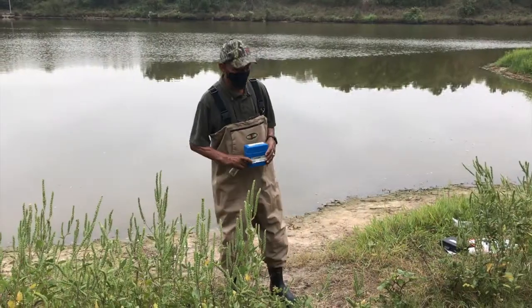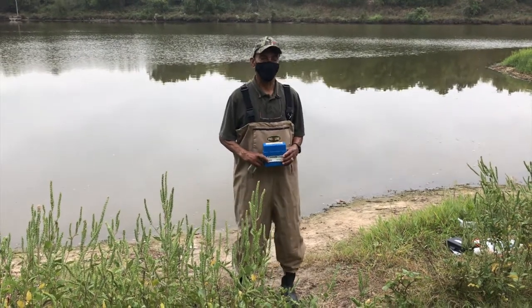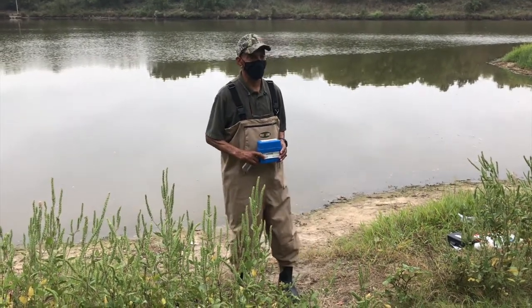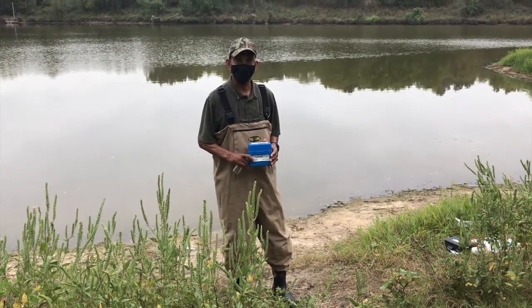Good morning, students. My name is Mr. Monroe, and my part of your virtual field trip today, while you're studying a fresh body of water that we refer to as being lentic, is to take a pH reading.